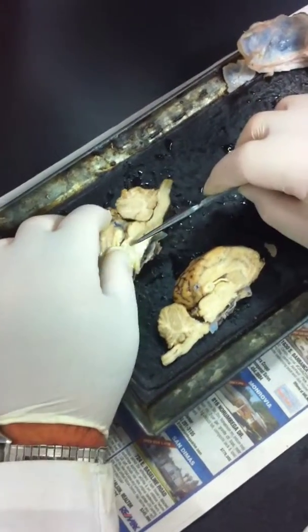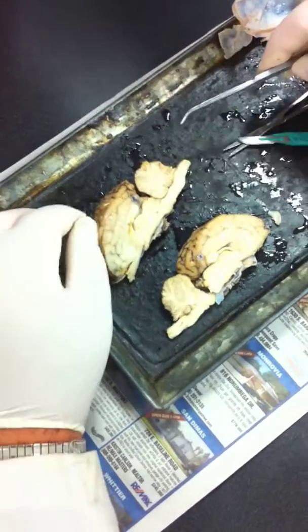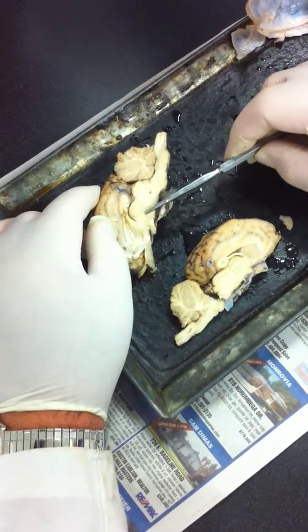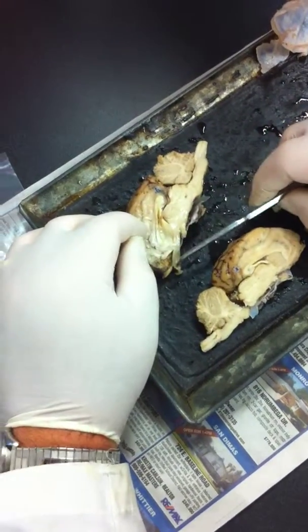No, that's the pineal gland. What am I talking about? Dr. Poner, get it right, man. Okay. So what's this again? That's the thalamus. What's this here? Hypothalamus. That's the pineal gland. All right. So corpus callosum.